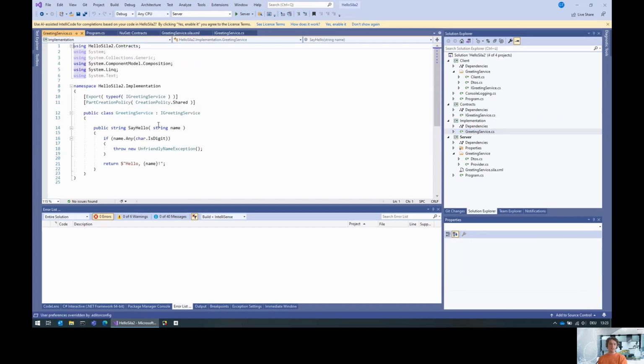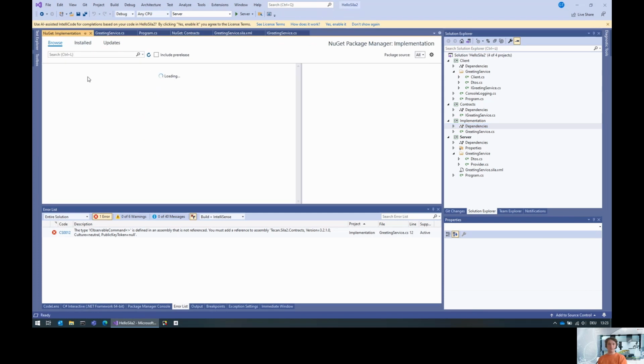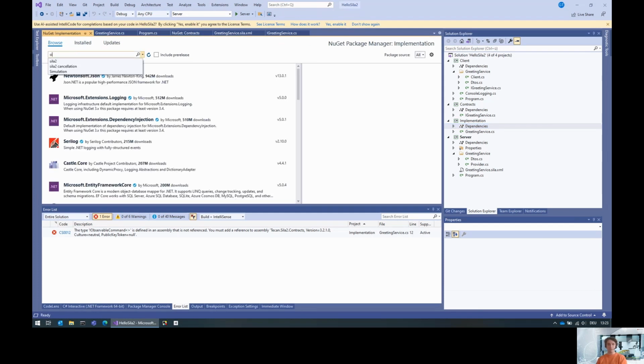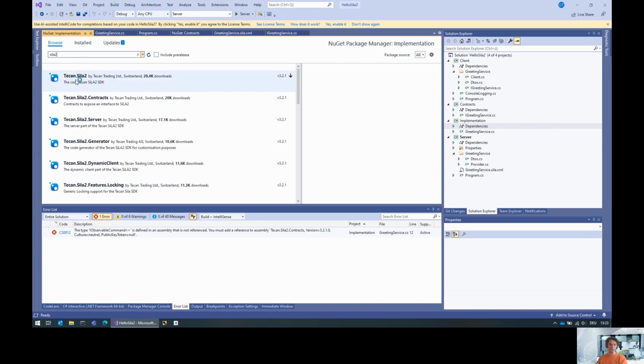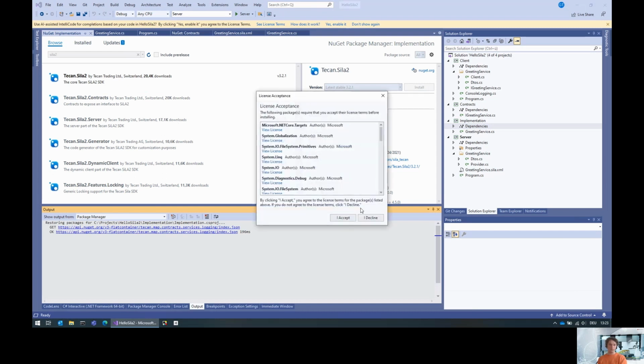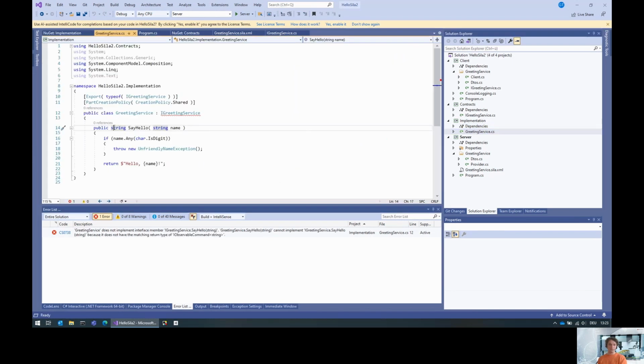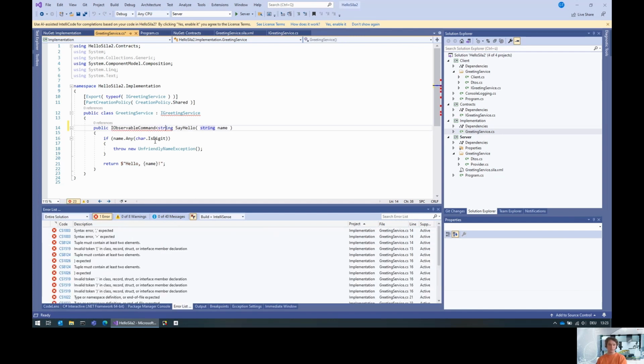Now, the problem is that implementing the greeting service is a bit more complicated, because you also need this IObservableCommand interface in the implementation. For that, you should also add a reference, and I would recommend a reference directly to the SDK itself, because this basically means this is an IObservableCommand of string.